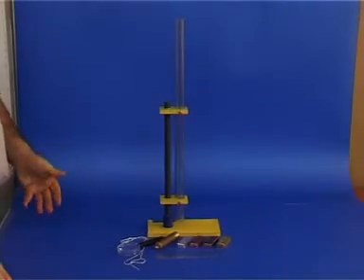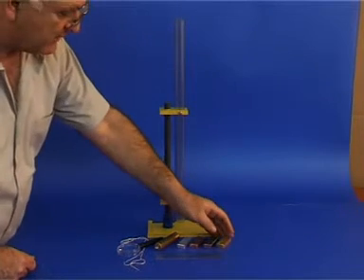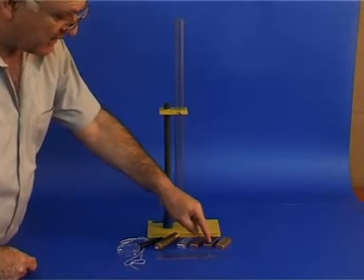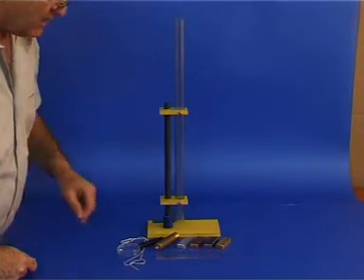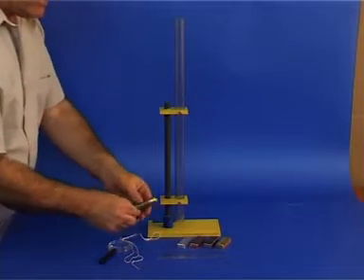Using this device we can determine the relative hardness of metals. We have four pieces of different metals: aluminum, copper, iron, and brass. We also have a ruler, a magnifying glass, a piece of string, and a cylinder-shaped weight with a steel ball at its end.